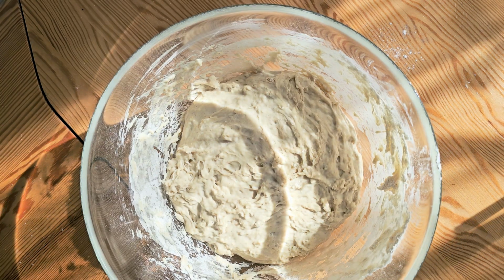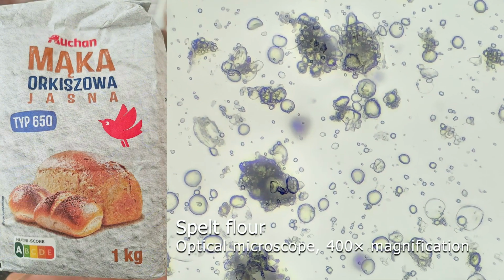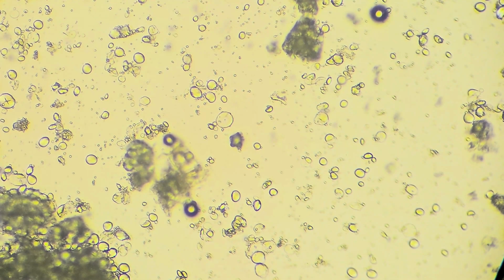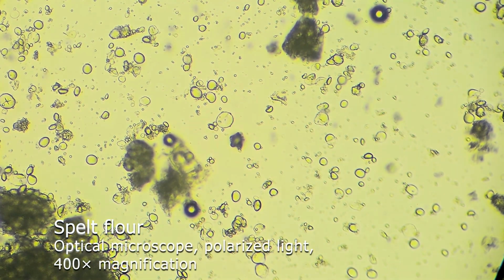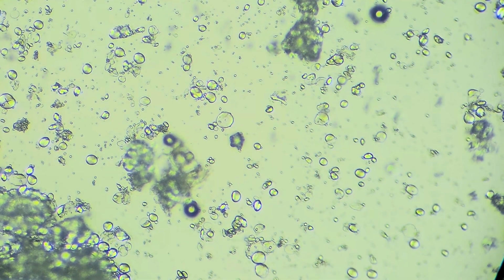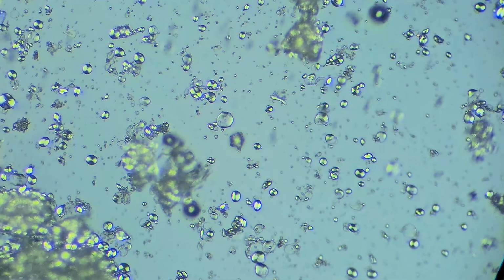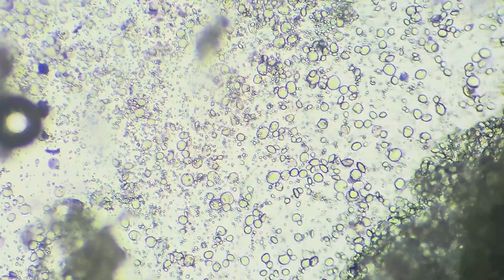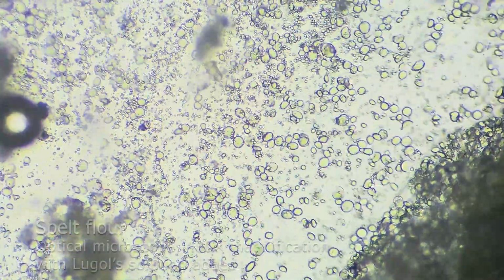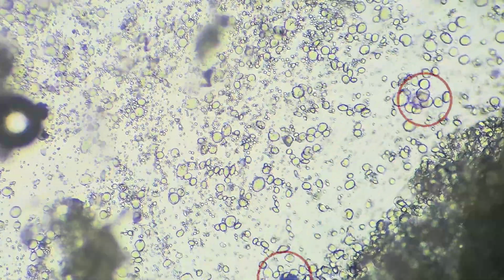If we look at flour under the microscope, we can see a large number of starch granules. They look especially impressive under polarized light, where the granules change color and shimmer depending on the angle of the light. This starch is what provides the yeast with energy for fermentation. Additionally, if we add iodine to flour, we can observe a color reaction. The starch combines with the iodine to form characteristic dark blue or dark purple complexes.